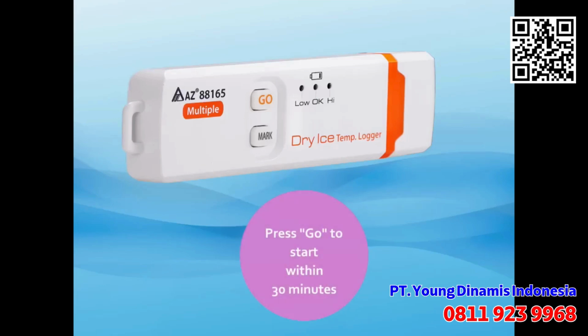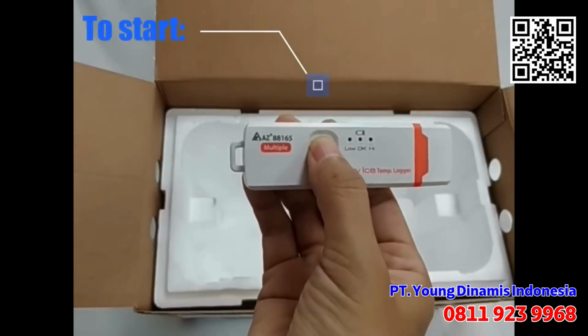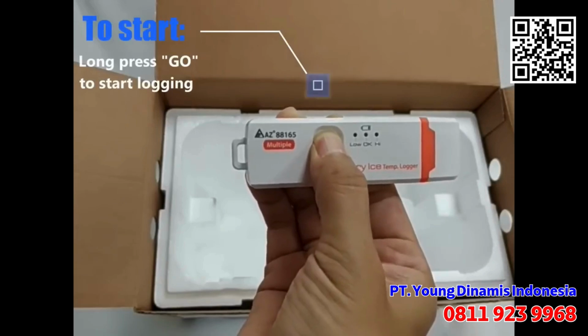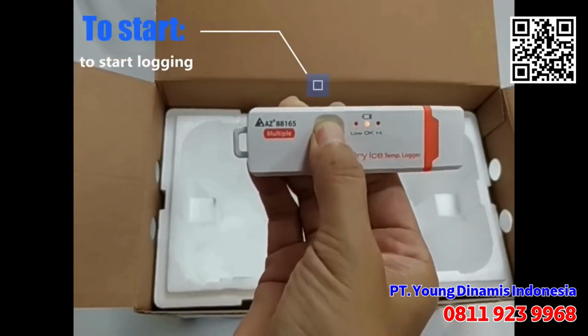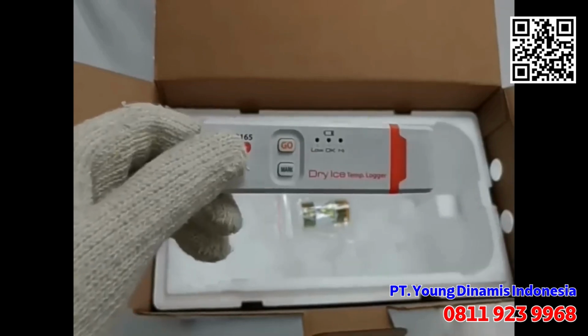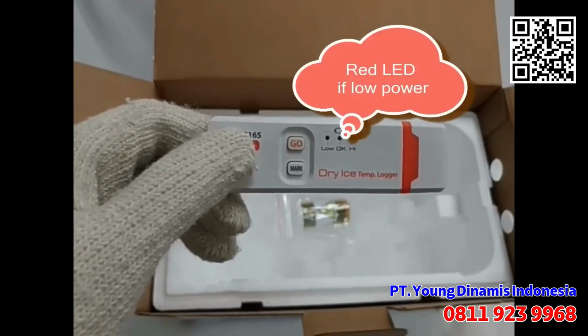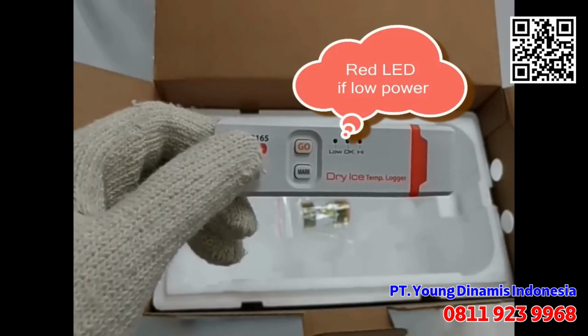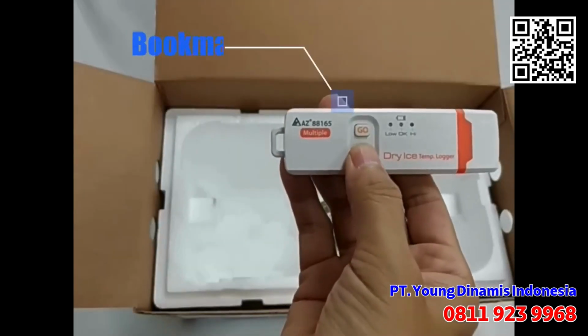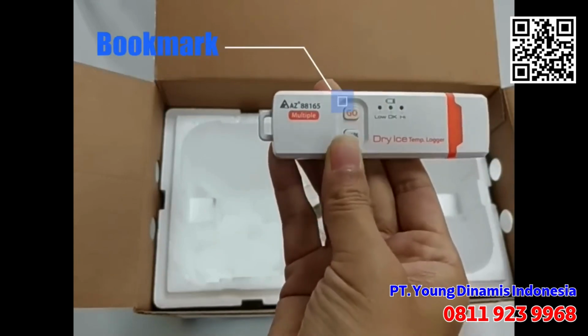After configuration, activate the recording within 30 minutes or the logger will sleep again to save battery power. Press go button for 5 seconds till red LEDs flash in sequence 3 times. The green LED blinks every 10 seconds during the recording status. If battery power is too low, red LED blinks. To place a bookmark, press mark button for 5 seconds till the red LEDs flash in sequence.